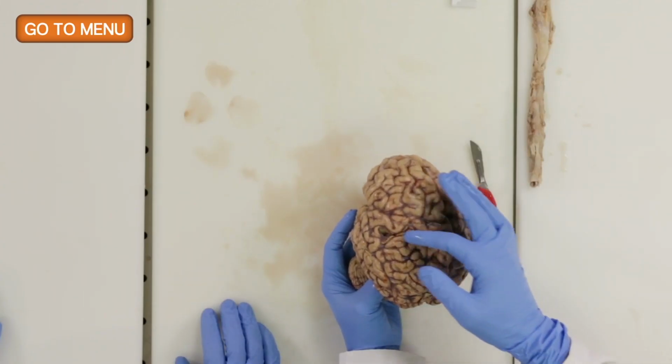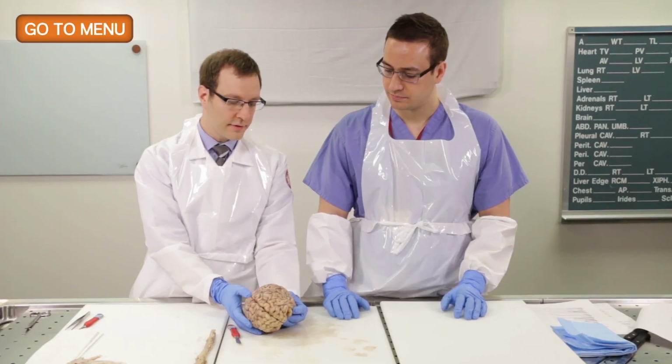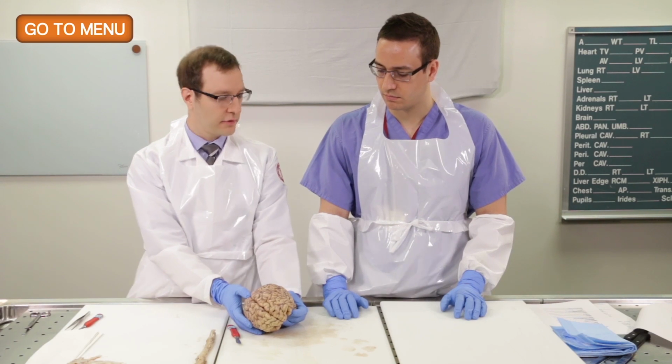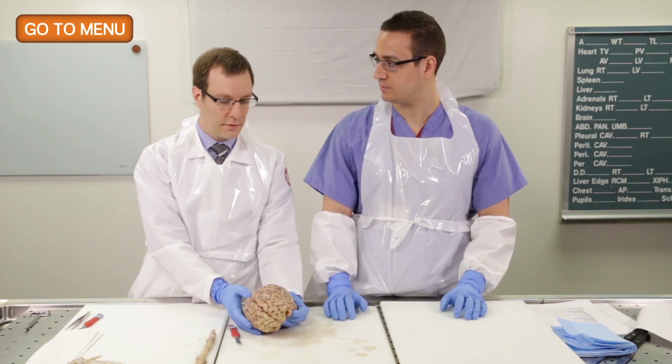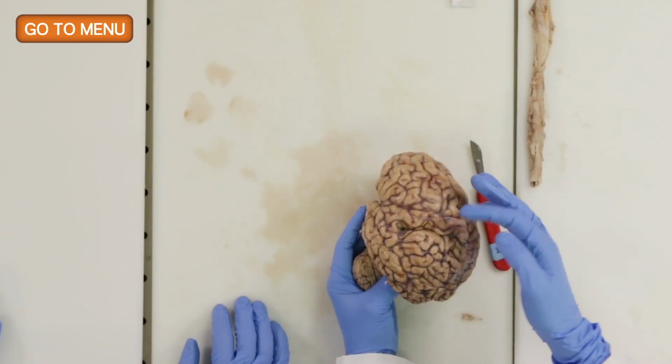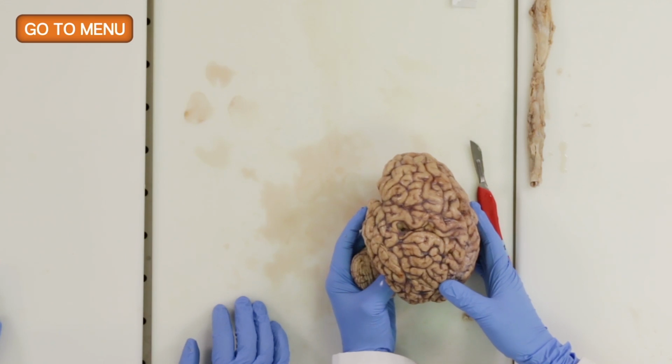That's right. So which vascular distribution do you think this is in terms of the anterior circulation, the middle circulation, or the posterior circulation? This should be supplied by the middle circulation. That's right. So this distribution, you also always have to correlate with your vascular anatomy, correlates with middle cerebral artery distribution.